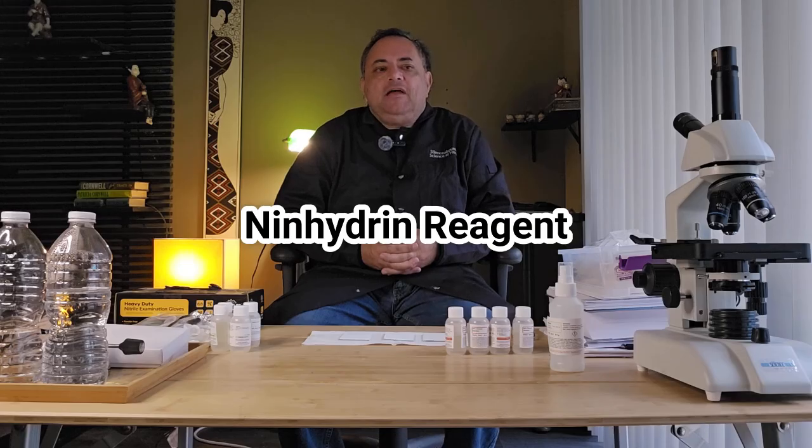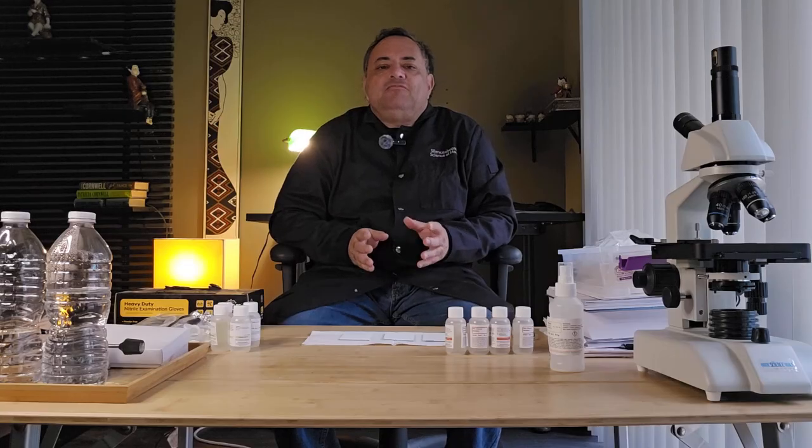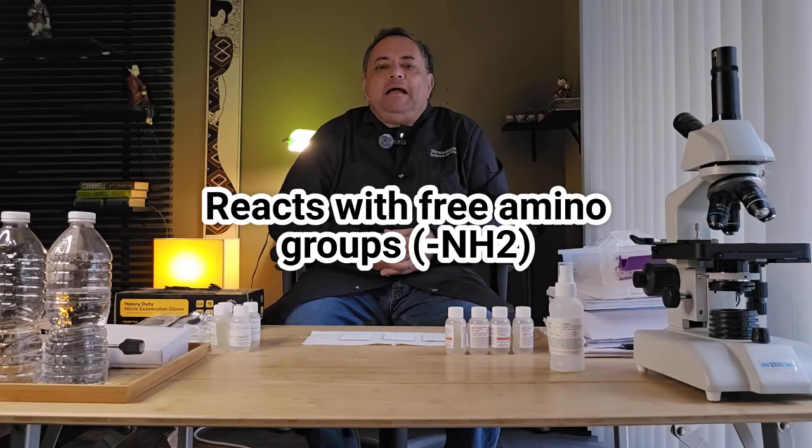Today, we're going to stain our plates using ninhydrin reagent. Now, the ninhydrin reaction is a classic chemical test used to detect the presence of amino acids and proteins. The reaction involves ninhydrin, a chemical reagent that reacts with free amino groups.